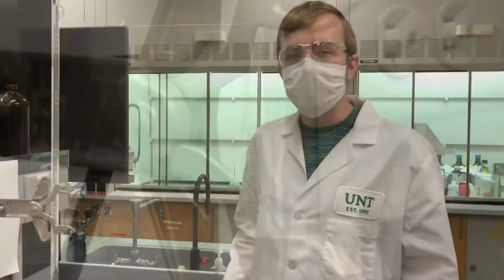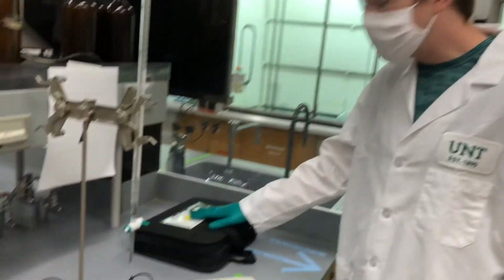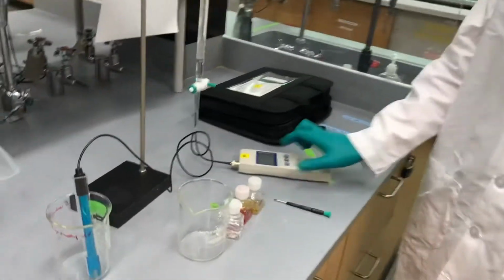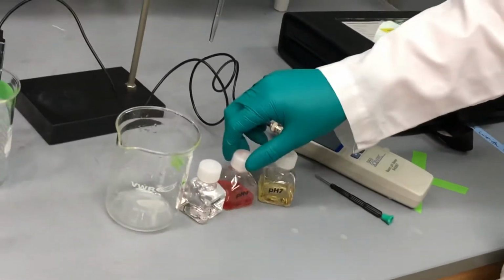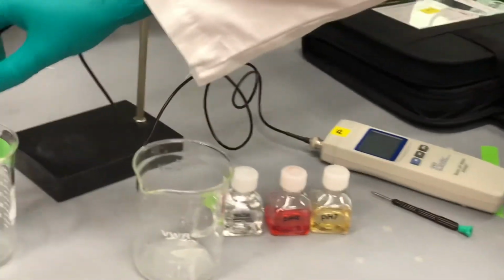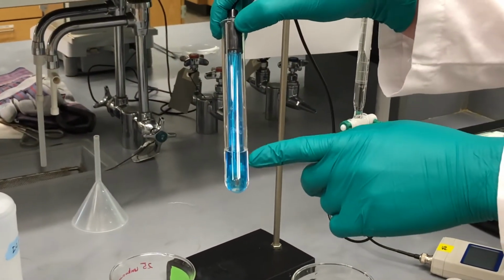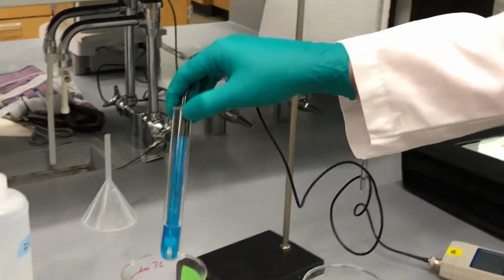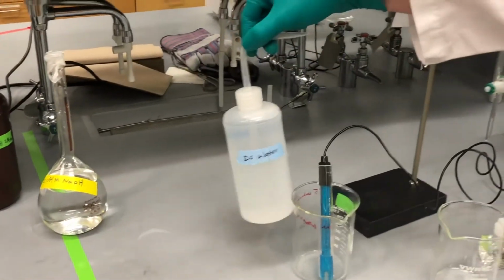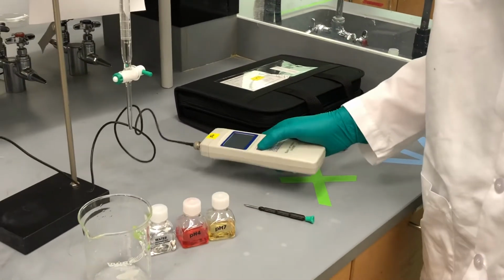I'm going to show you how to set up the pH probe for calibration so that you can use it for the remainder of the experiment. And this black bag that should be set here on your table should contain the pH probe, a small screwdriver, and 3 small bottles of water, pH 4 buffer, and pH 7 buffer, along with your pH probe. Your pH probe should be immersed in chloride solution or electrolyte solution so that it does not dry out. And you should also try to use a deionized water bottle so you can rinse off your pH probe.